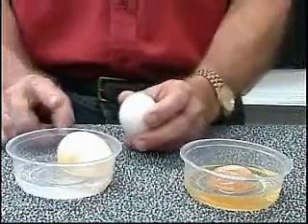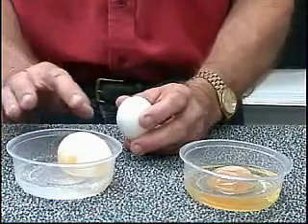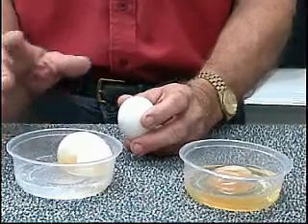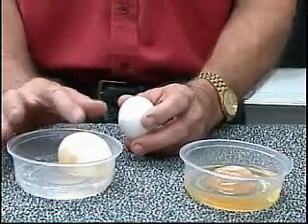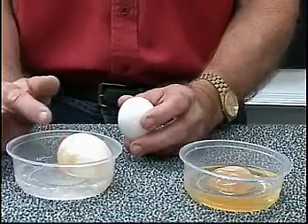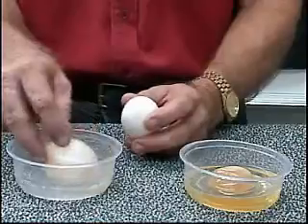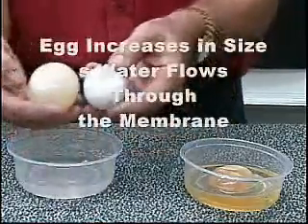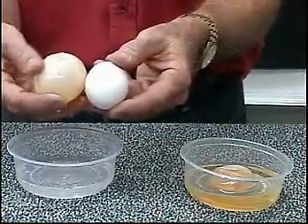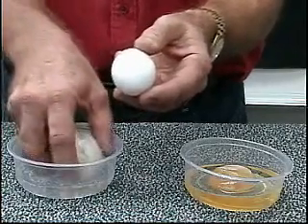In the container on your left is the egg that we had in tap water. As you remember, this egg was in a hypotonic solution — a solution that had a lower concentration of dissolved solutes than we found in the egg itself. As a result, water passed osmotically through this selectively permeable membrane and the cell actually increased in size. If we look at these two eggs, you can see fairly clearly the original size of the egg and what we have after several days in that water solution — this cell has taken on water.